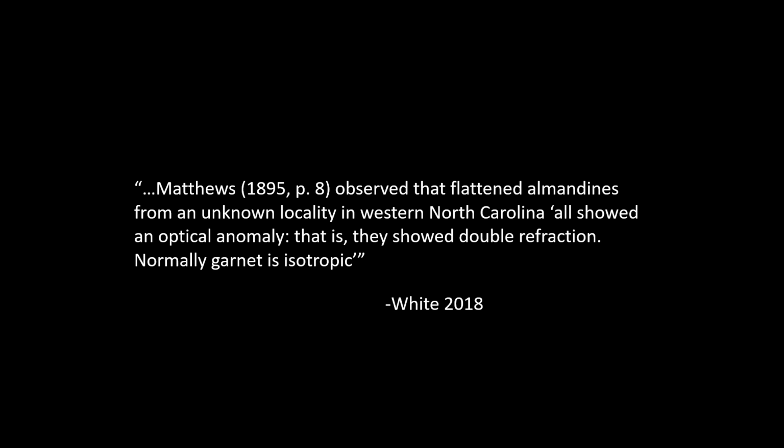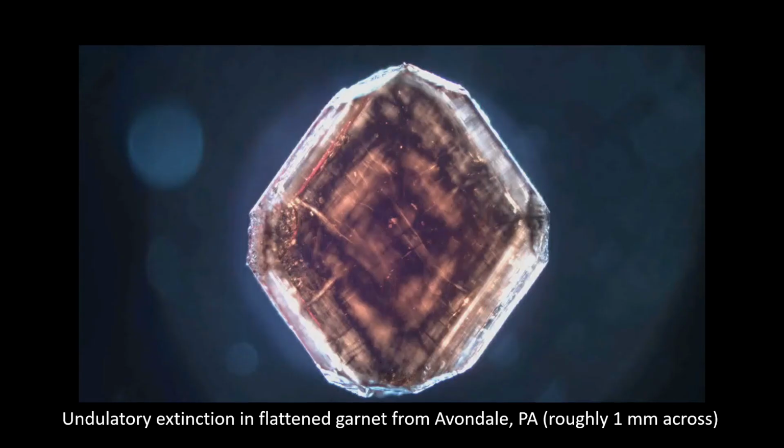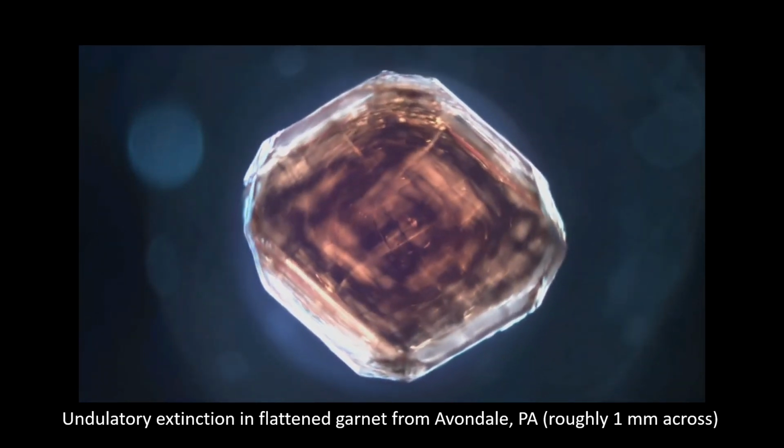So when we placed the garnets that we had under a petrographic microscope, these particular ones being from Avondale, Pennsylvania, this is what we saw. On the left is a crystal about 1 millimeter across in plain polarized light. You can see it has that very nice red color that you would expect from an almandine. And then on the right is the same crystal in cross-polarized light. You can see it has these zones of uneven extinction, much like the gahnite did. And when viewed in a movie, the wavy pattern, that undulatory extinction, you can see it move across the grain.